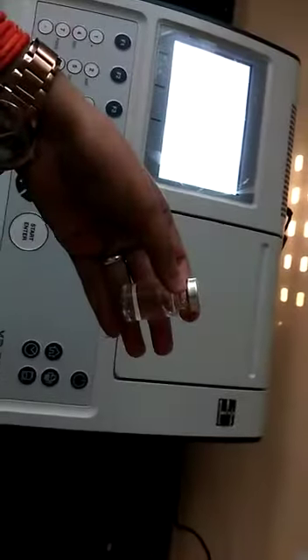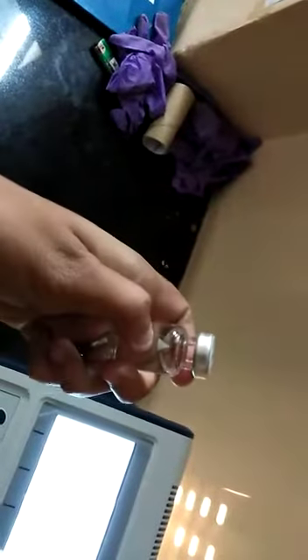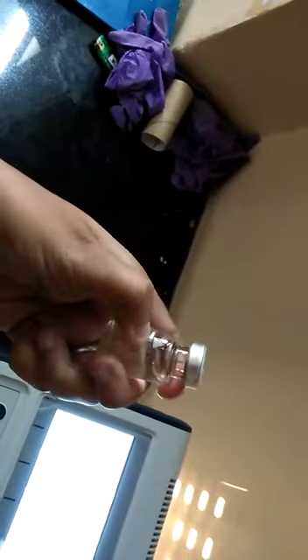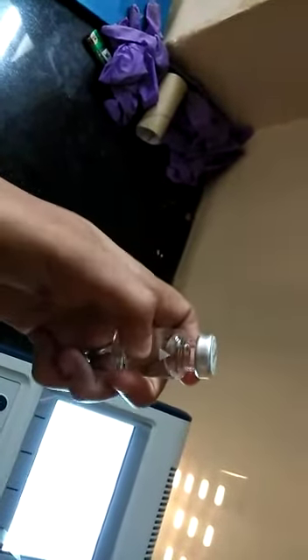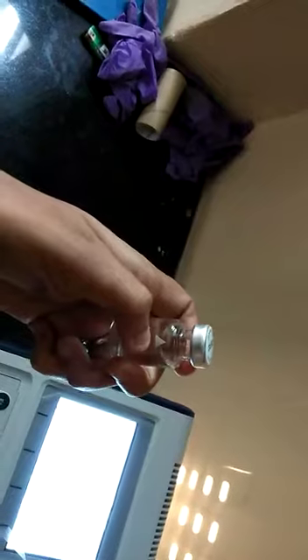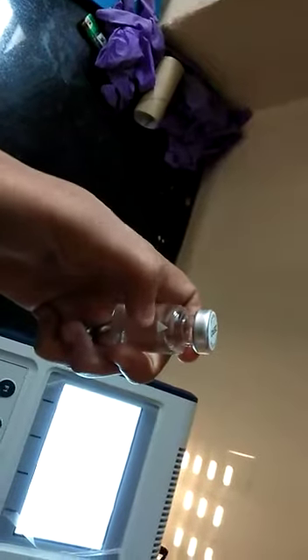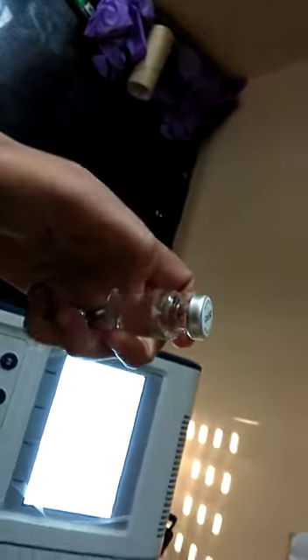In the meanwhile, we call this a cuvette. You should make this cuvette ready. This is a zero cuvette. Let me show you how you need to insert it inside the spectrophotometer. Can you see this marking here? It's like a white color triangle. That marking has to be taken care while inserting this cell inside the spectrophotometer.